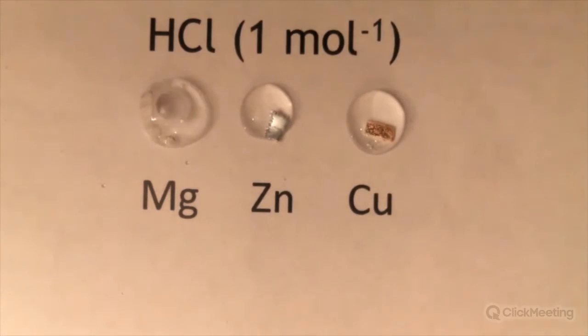And you can see that the magnesium is the most reactive metal. It's fizzing quite vigorously and producing hydrogen. And on the left-hand side of the zinc, we're seeing some hydrogen being produced. So they can come up with a reactivity series of magnesium, zinc, and copper in order of reactivity. Copper won't react with dilute acid, but you can react it with more concentrated acids in a Petri dish on a small scale to generate nitrogen dioxide, of which you can test the pH using some pH indicator.